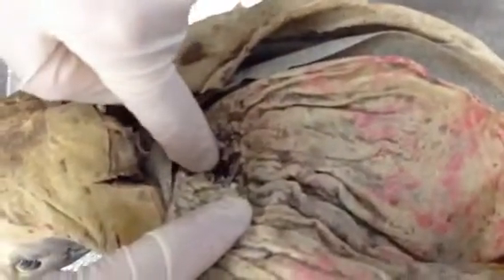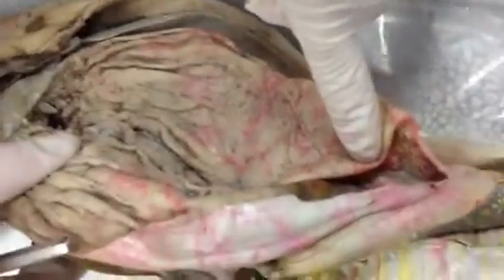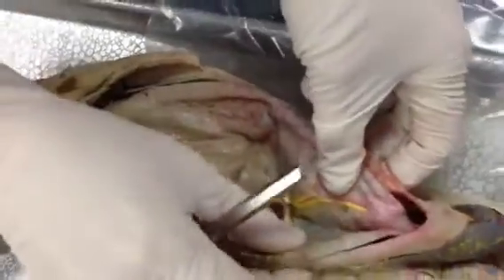When you cut open the stomach — which is here — and the esophagus is up here, you know you're in the esophagus because you have papillae. In the stomach you have the rugae, or folds. So that's the esophagus and the stomach.